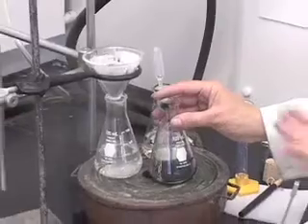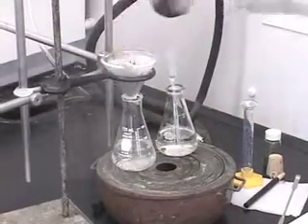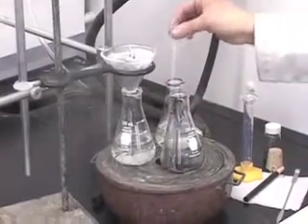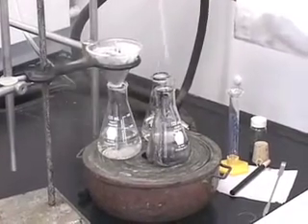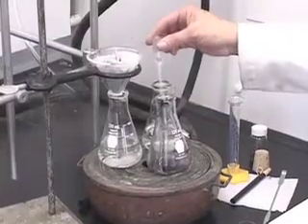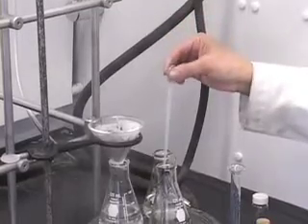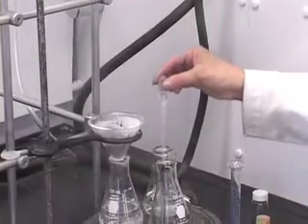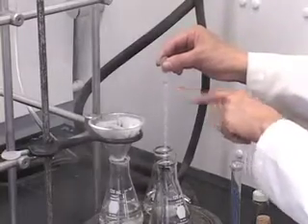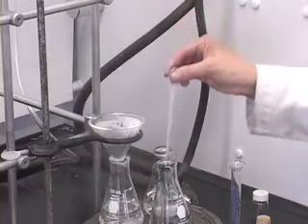Heat it. Of course, the solvent was already hot, so it won't take that long to warm it up. Transfer the contents. And another 5 ml portion. By the way, this plastic pipette also measures 1 milliliter. The 1 ml mark is up to here. So if you want to use that as a measure, that's okay. Then you can do 5 times. If some of you didn't notice where the 1 ml mark was up to, it is written here. When you use the pipette, you can just take it out and see where it is up to. Then use that.